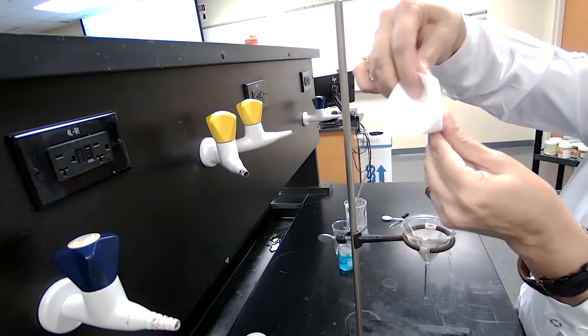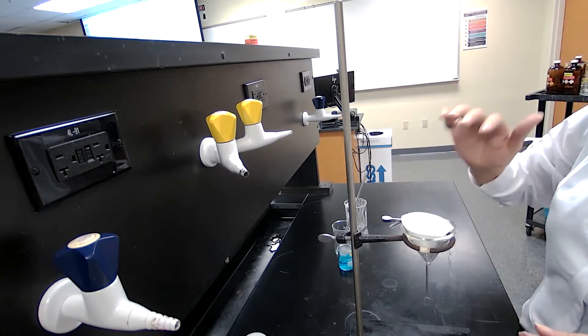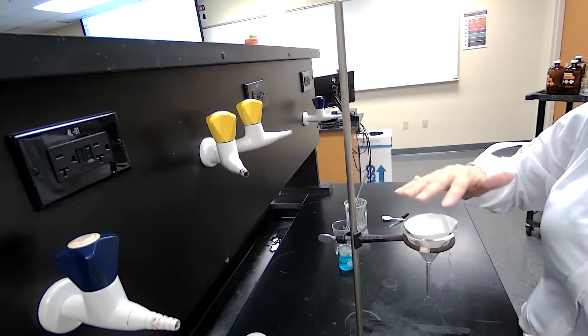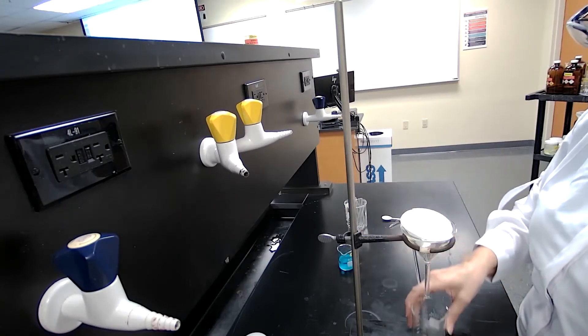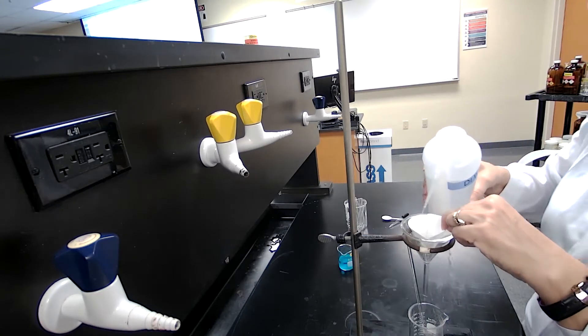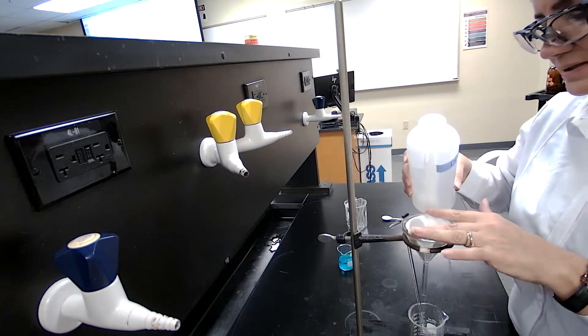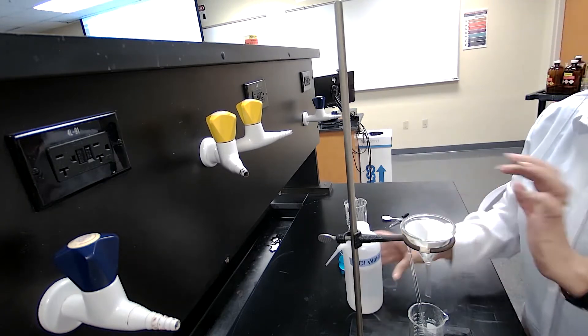You've basically made a paper funnel. You place it in the glass funnel, but it's not staying still. In order for this to stay still, I'm going to add a few drops of water. When I add some water to the filter paper, the filter paper is going to stay still.